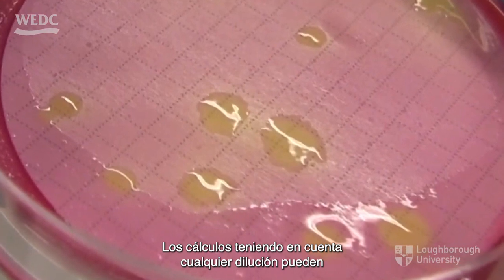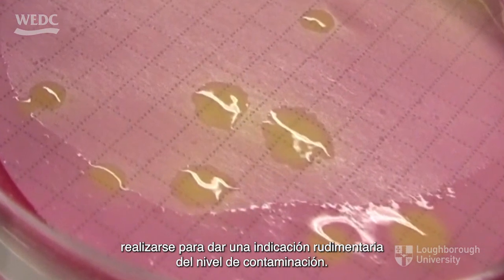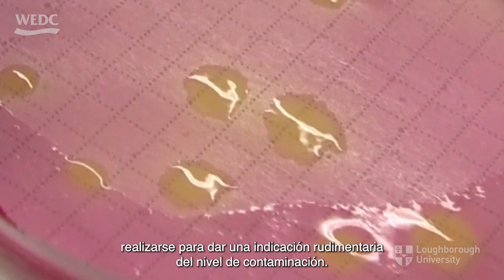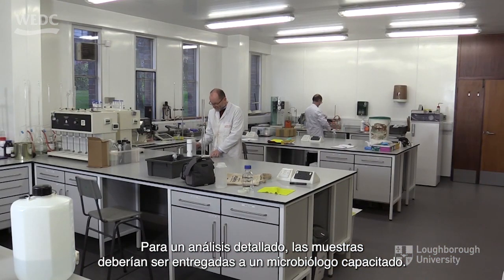Calculations taking into account any dilution can then be made to give a rudimentary indication of the level of contamination. For detailed analysis, the sample should be passed to a trained microbiologist.